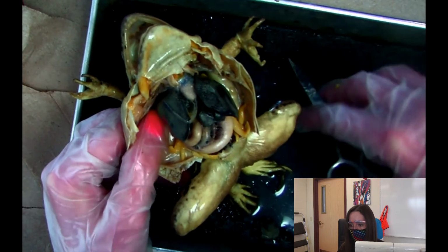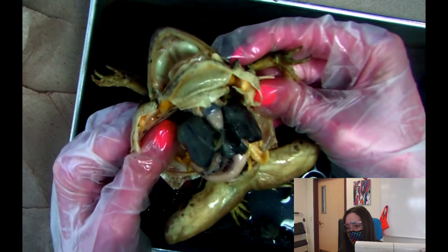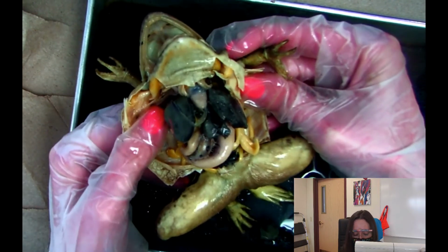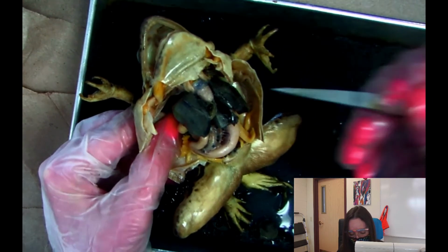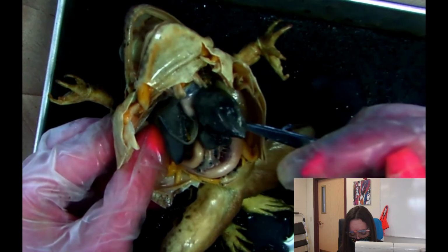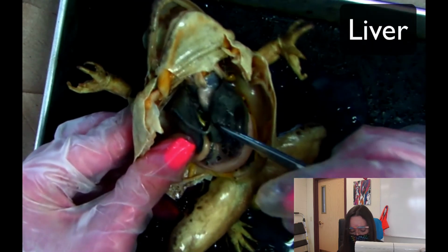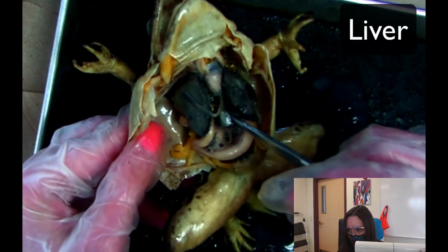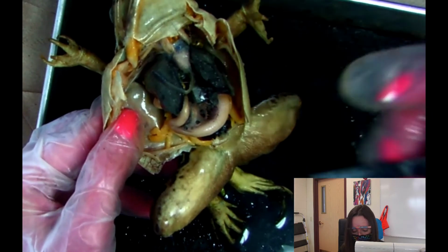I'm going to try my best to point stuff out for you and make it as easy as possible because I know the contrast is a little weird, but we could do this. So one of the bigger organs on the inside, you would think that this is the lungs, but it's actually not. This right here, these things, it gets kind of closer together. This is the liver. So it's actually a 3-lobe structure. I accidentally tore off a little bit of the liver. It's right here. But this is the liver.